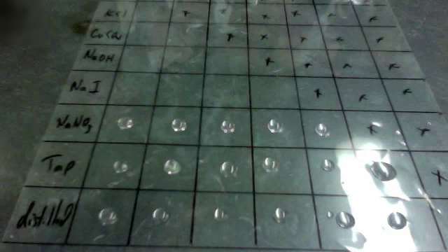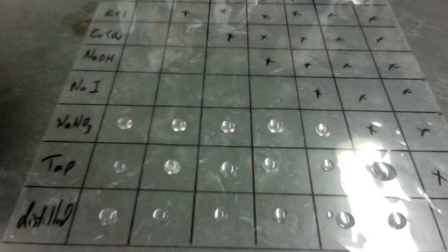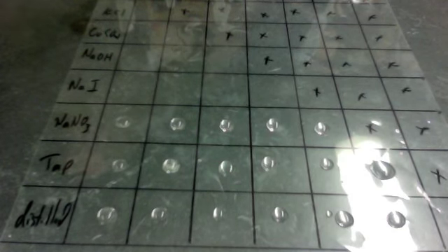Tap going with distilled. And what we're looking for is a precipitate. A precipitate is when the solution wouldn't be clear but would appear cloudy because a solid would fall out. Okay, now I'm going to do sodium iodide. Whoops, sorry, I bumped you there. Sodium iodide.